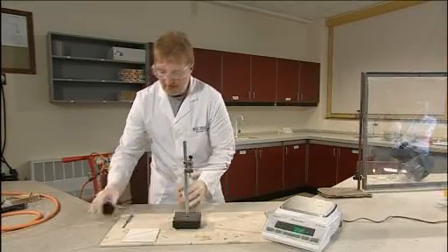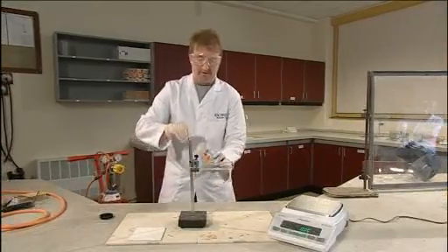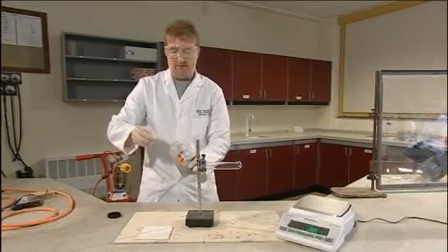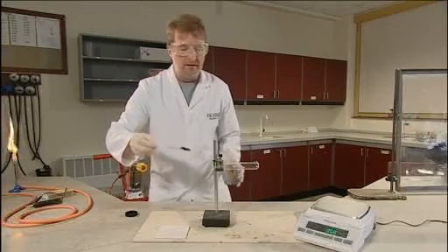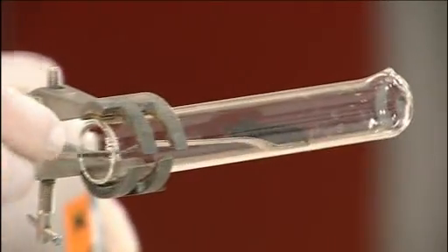We now place about three grams of copper oxide, which is really a couple of spatula fulls of the powder, into the reduction tube.